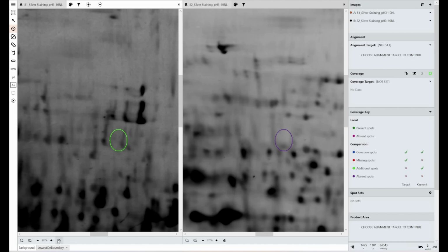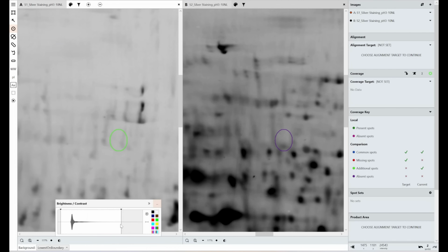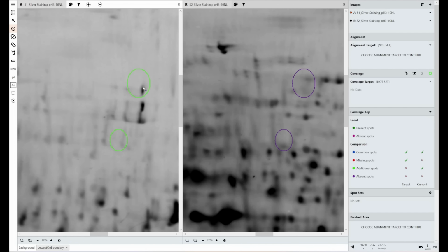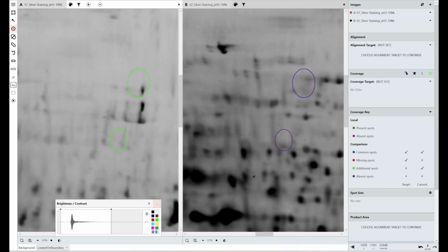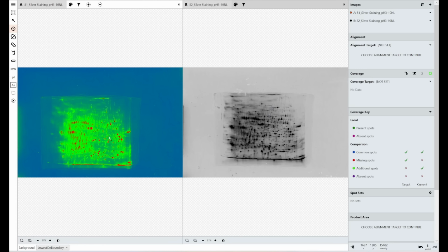I know that's not the most accurate spot drawing. And then you can extend the contrast again to get more accurate spot detection, drawing, manual spot editing of your very strong spots. It doesn't matter that these were drawn on at different contrast levels, because it's just analysing the raw data in the image, which our software never changes. But by using the contrast tools or the heat map tools that we've got within the software, we can make it much more obvious to the human eye where our faint spots are.